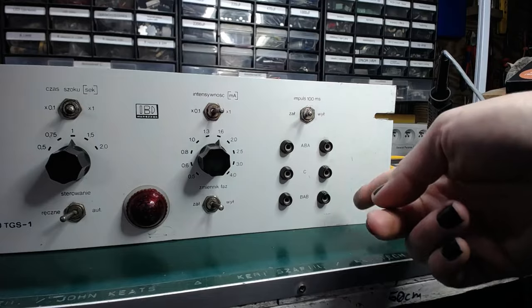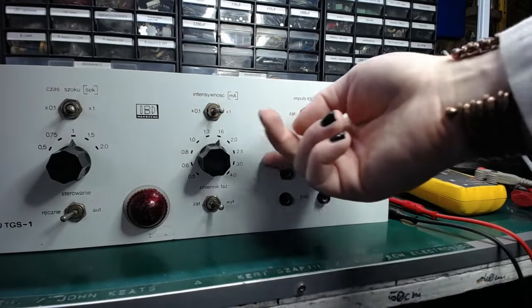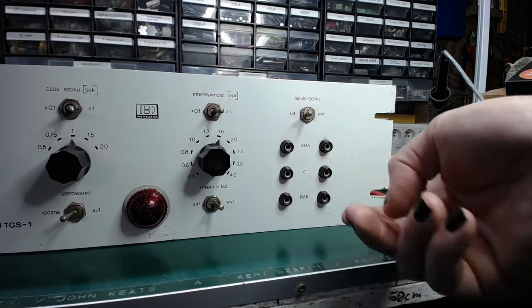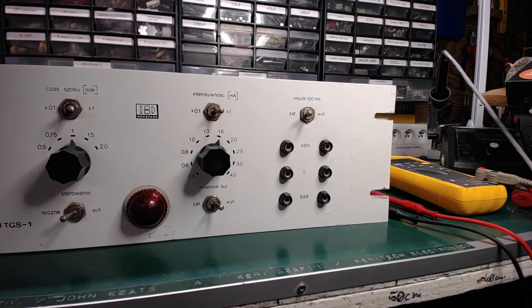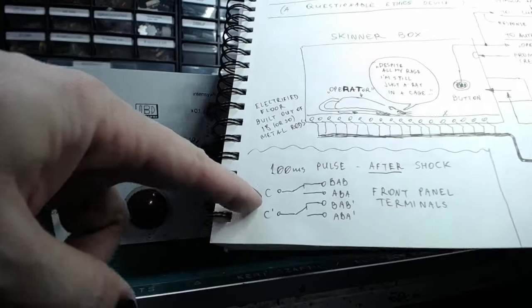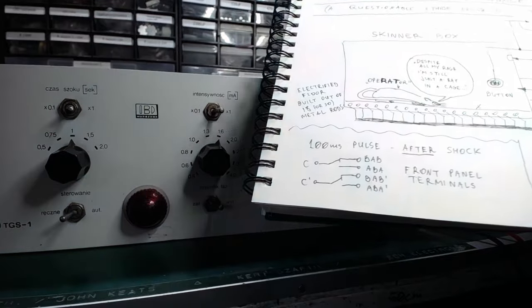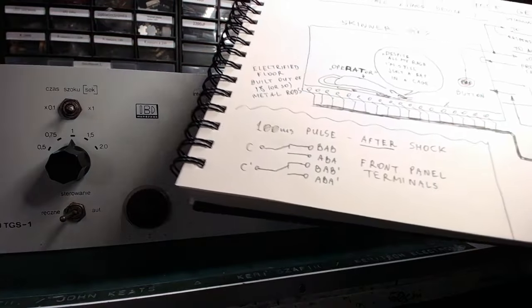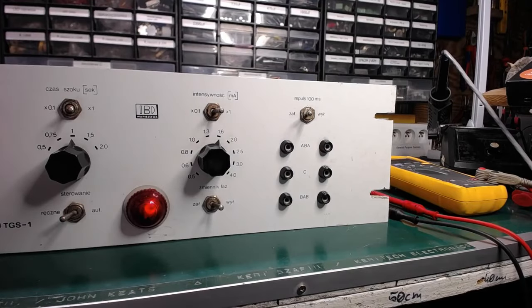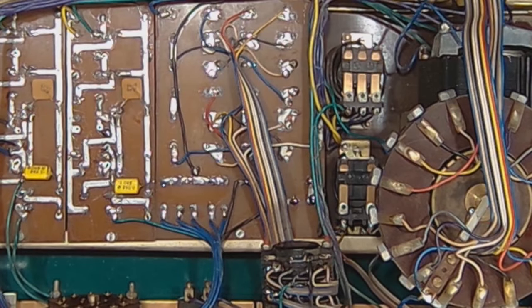So we've got the three pairs of contacts, ABA, C and BAB. And what I reverse engineered was that the C contact is the changeover contact, BAB is normally closed and ABA is normally open. So after applying the shock, the second relay will briefly turn on and then go off.